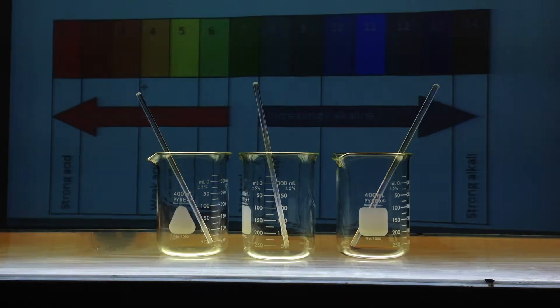Of course, that in-between color of 7 is green, because bromothymol blue will be, at that point, green. So we've got a whole range and spectrum of colors associated with these three indicators. And using the color-coded scale behind the beakers, we can figure out what the pH is.